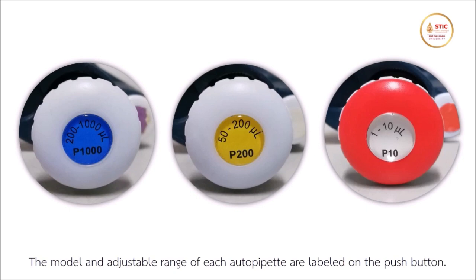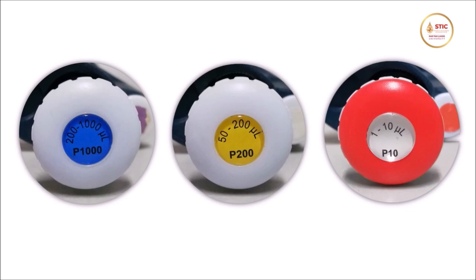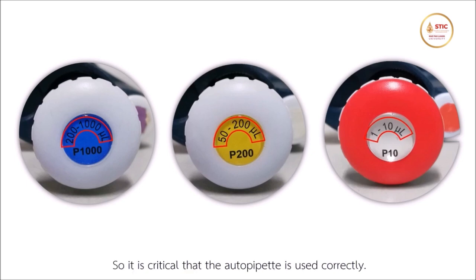The model and adjustable range of each autopipette are labeled on the push button. A capital P followed by a number indicates the maximum volume for that particular pipette. You should never use a pipette outside of its adjustable range. Improper use will result in inaccurate volume and will damage the pipette. So it is critical that the autopipette is used correctly.